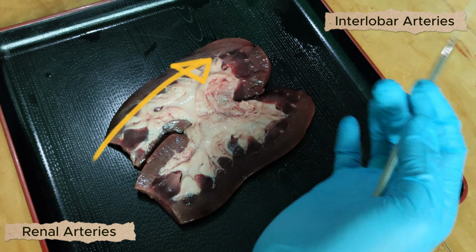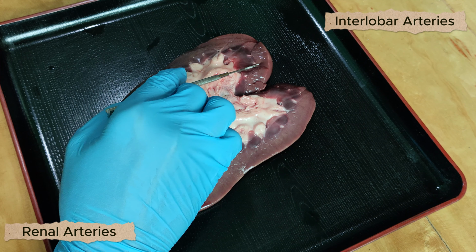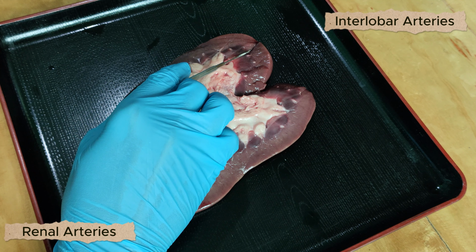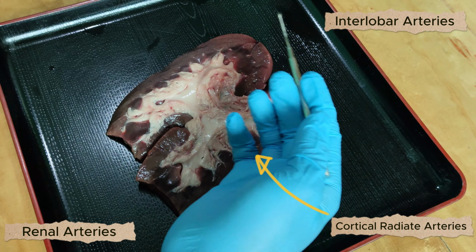Then it further branches into the renal cortex, going to the outermost part of the kidney, as the cortical radiate arteries.